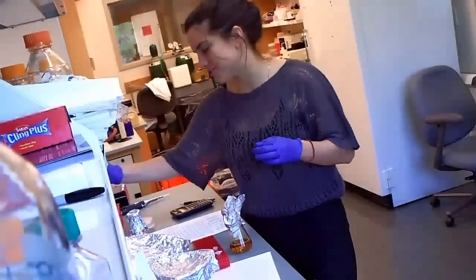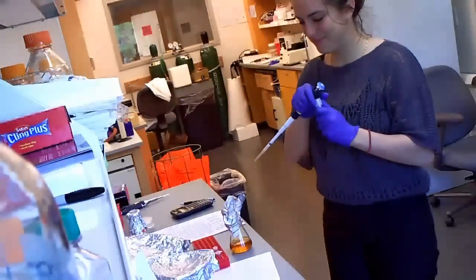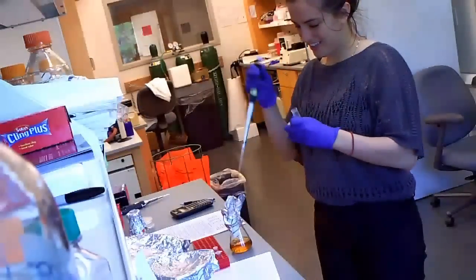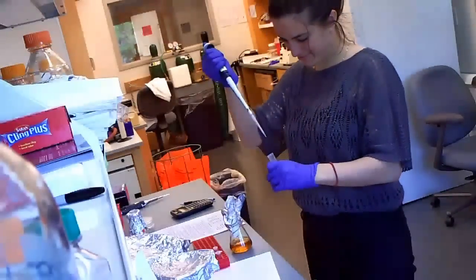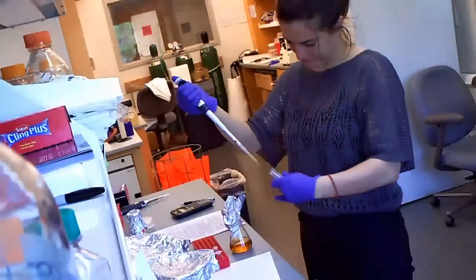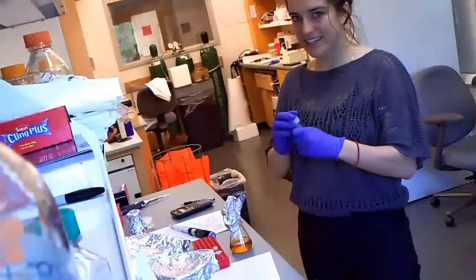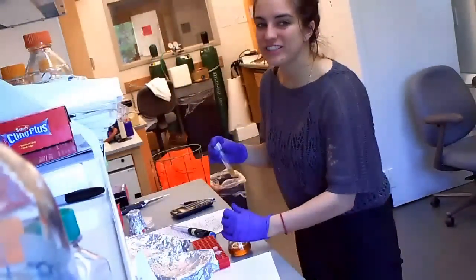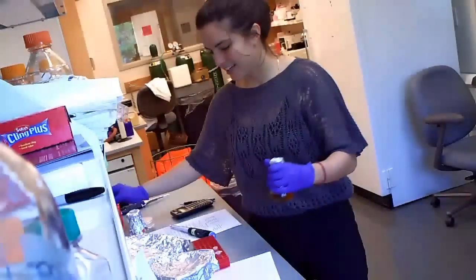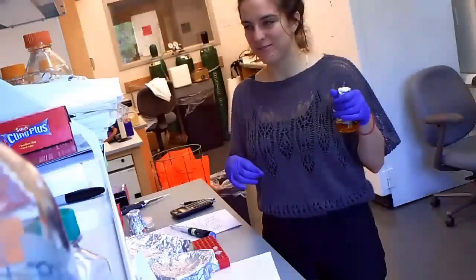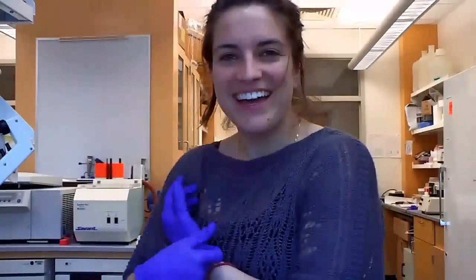So to do that, that's 300 microliters of grown-up cells. And now we'll incubate this for a few hours and measure the titer again to make sure you have the correct concentration. And then we'll make them competent with lithium acetate.